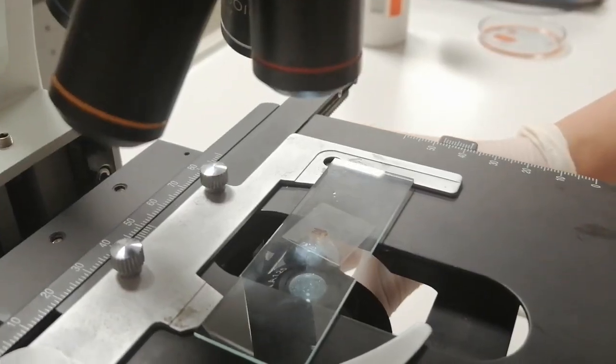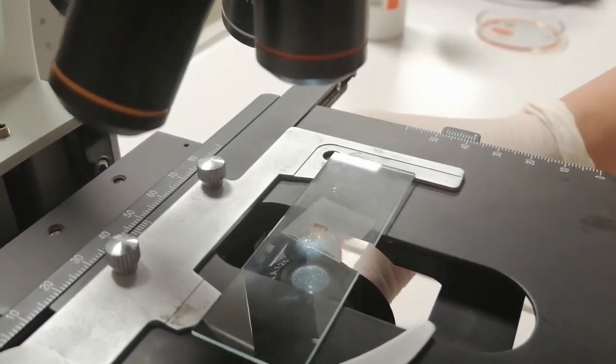It is time to examine the slide under the compound light microscope.